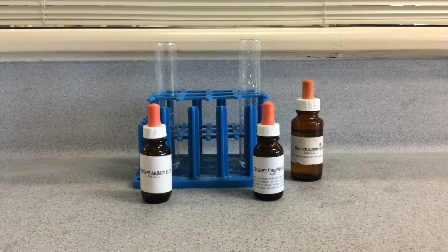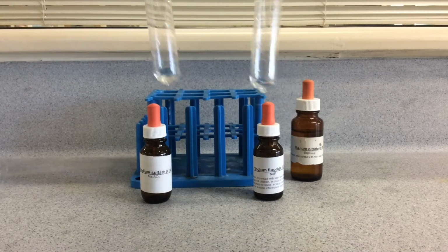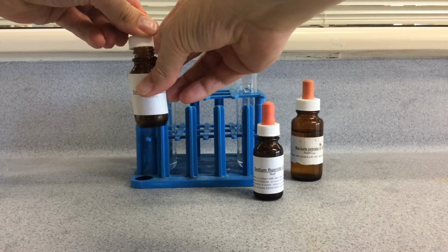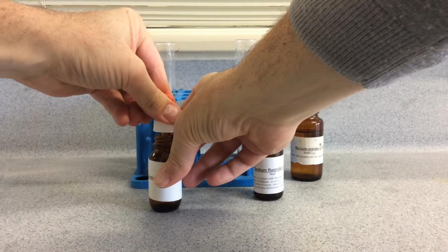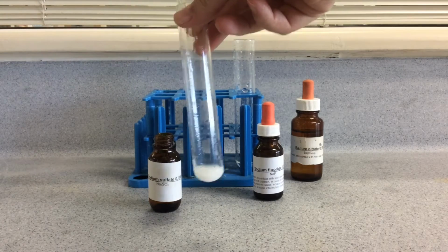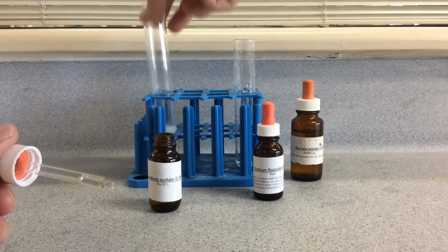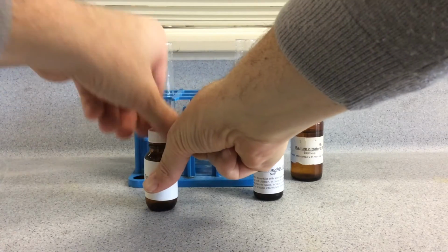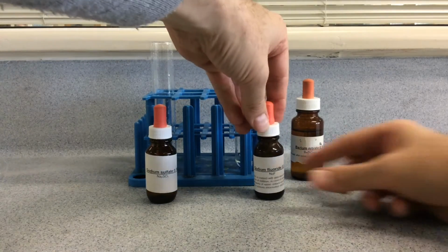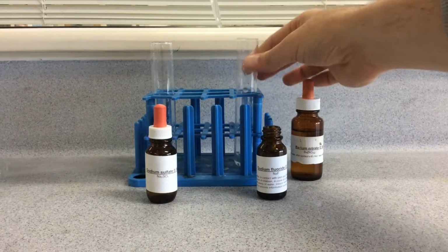The second cation we will test for is barium. So there's barium nitrate in each of those. To test for barium, you first use a sulfate. Now remember, barium and calcium will both form a white precipitate with the sulfate. So there we go. So to distinguish if it's barium or calcium, you then need to do a second test on the sample with fluoride, and the barium will not form a precipitate with fluoride, whereas the calcium will.